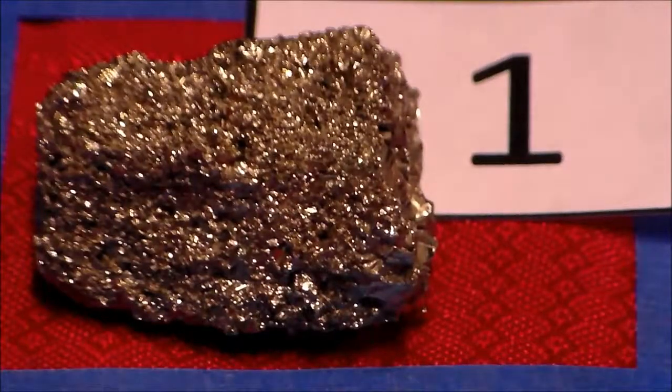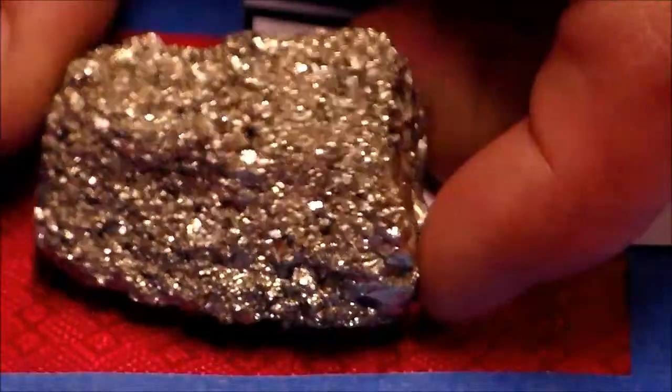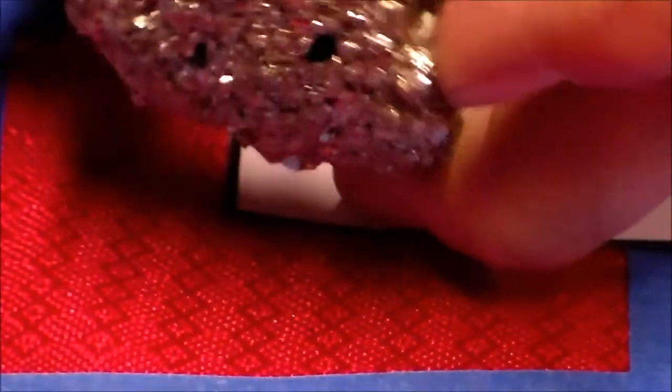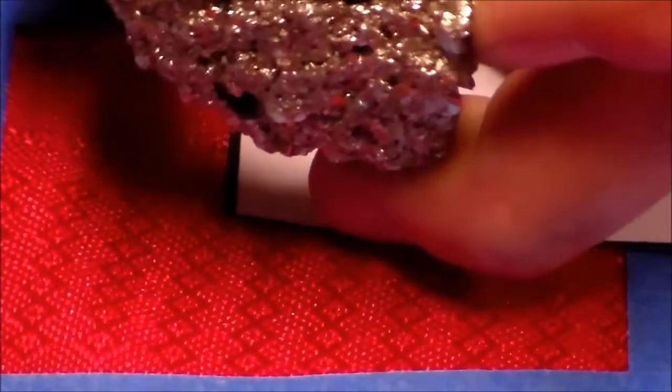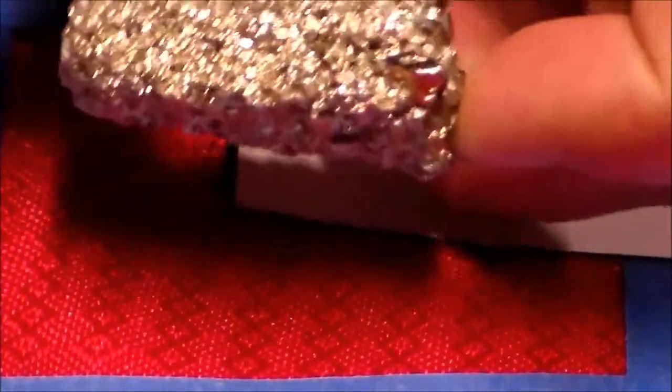Okay, then we need to look at the mineral. What color is it? Color's not always a great way to determine what mineral is. Like I said, again, because the outward appearance could be a little bit different. But our streak is always going to be the same. So we know we've got a streak that's greenish black. We've got a metallic luster. The color, if you can see it, it almost looks like gold. It's kind of a pale brass yellow color.